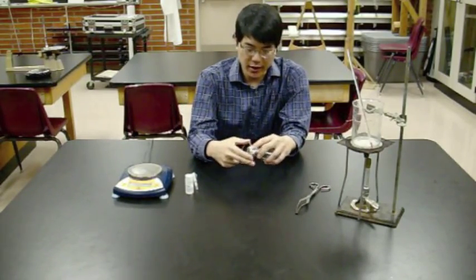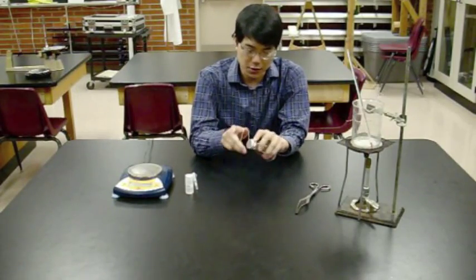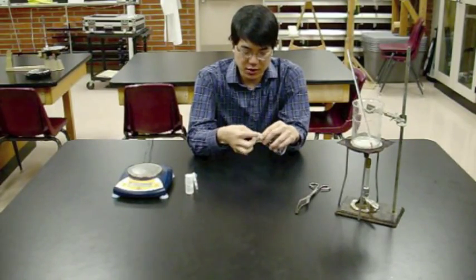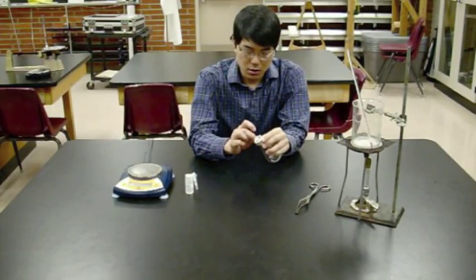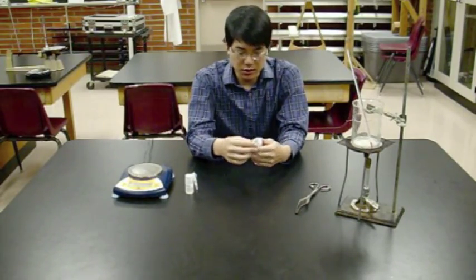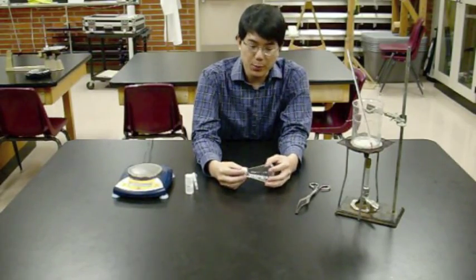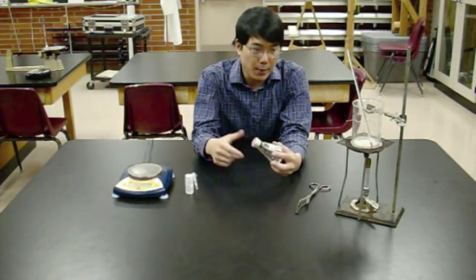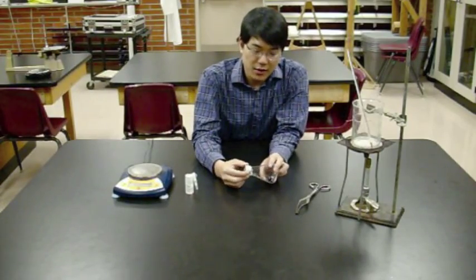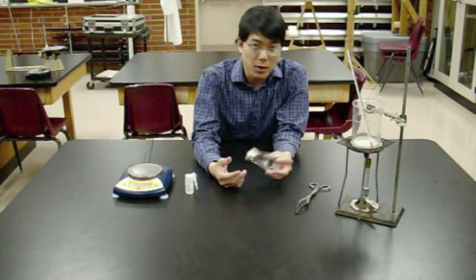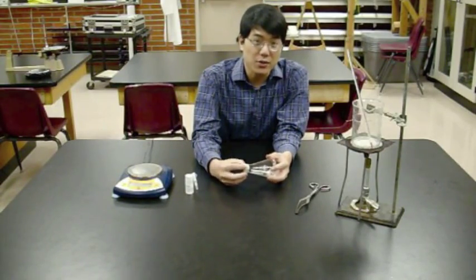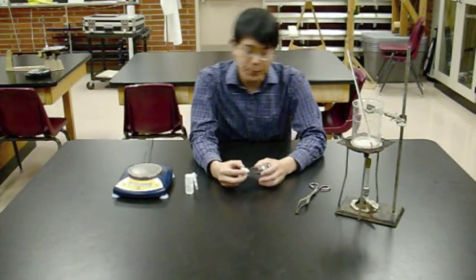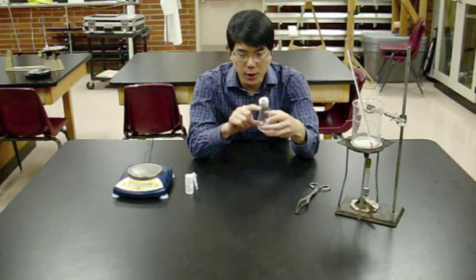Take a second rubber band and do the same thing. You use two rubber bands because their quality has decreased and they snap easily nowadays. The combination of high tension and heat from the water bath means there's a decent chance one will break. If one breaks, you'll have a backup.